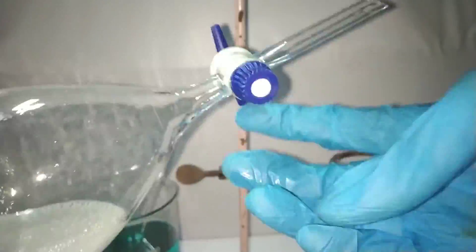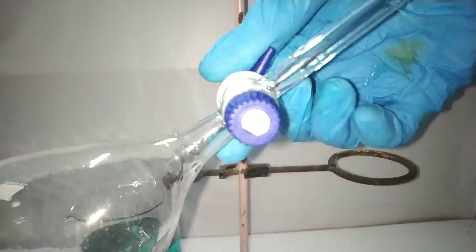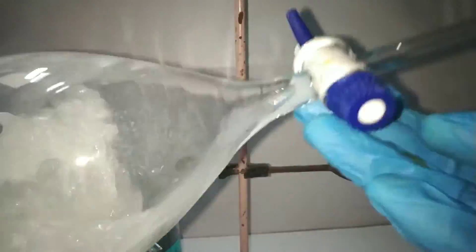After adding the salt solution, we cap, shake and vent frequently to release the pressure. After shaking for few minutes, we keep the flask undisturbed.